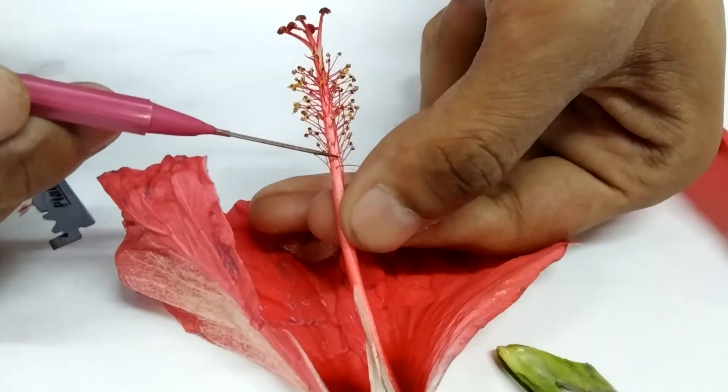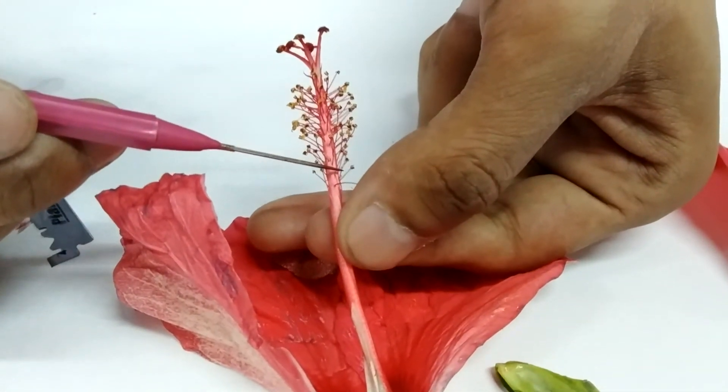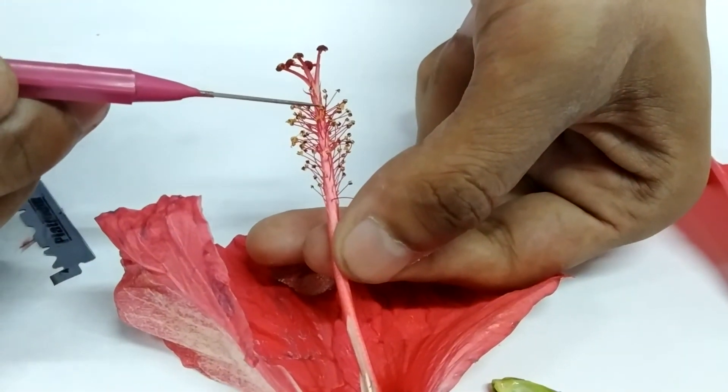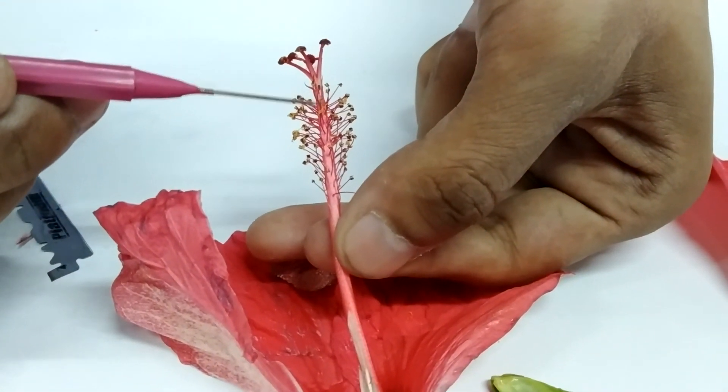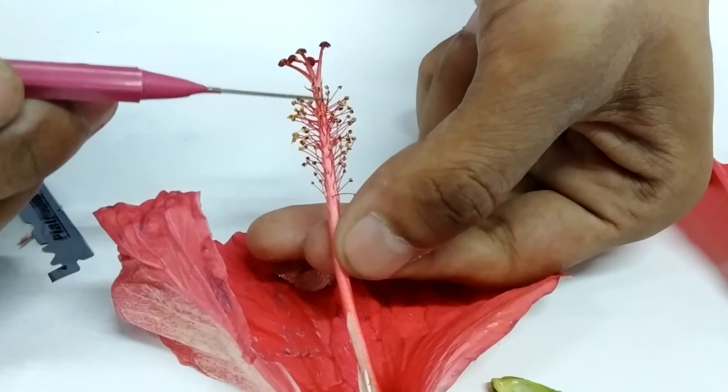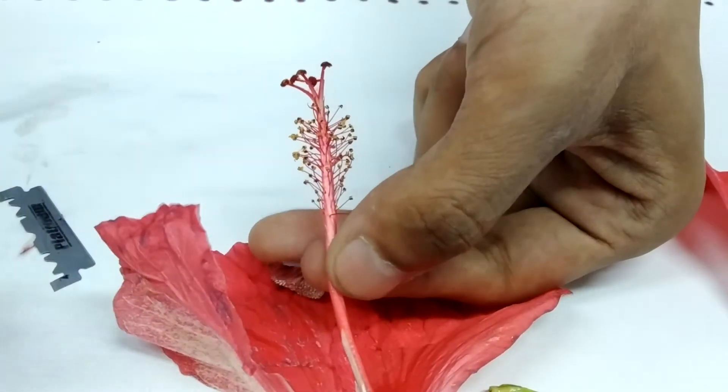The androecium portion is over here from here till here. This yellow portion is your anther, which produces pollen grains.